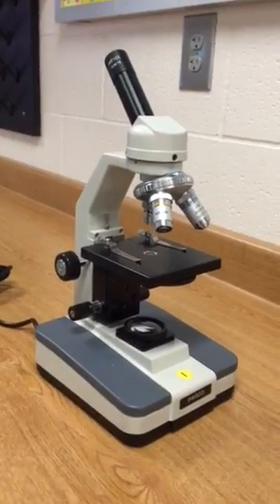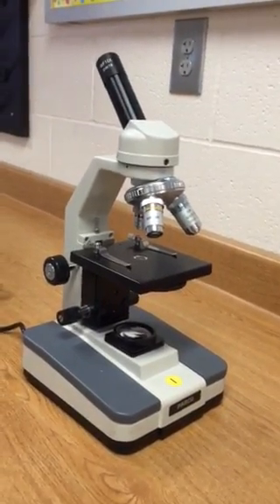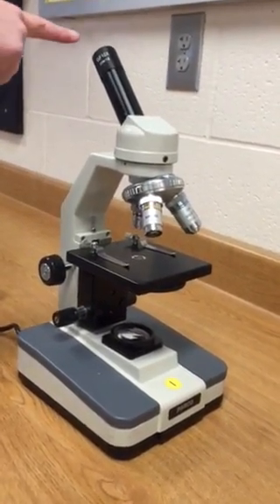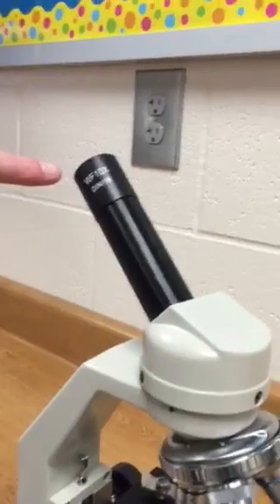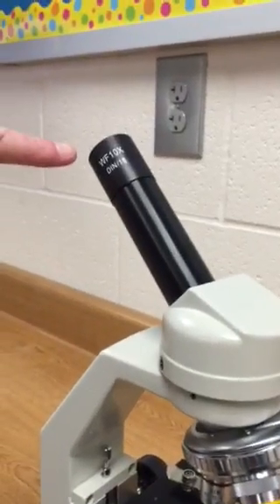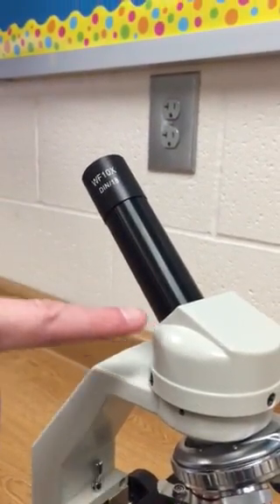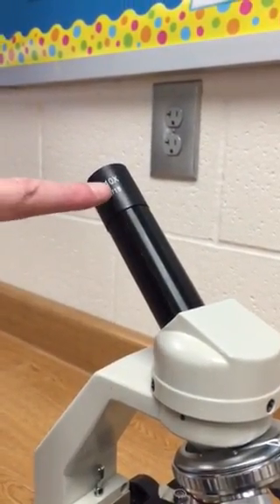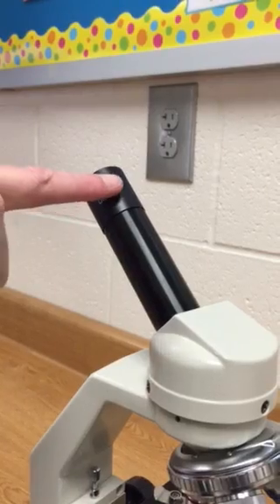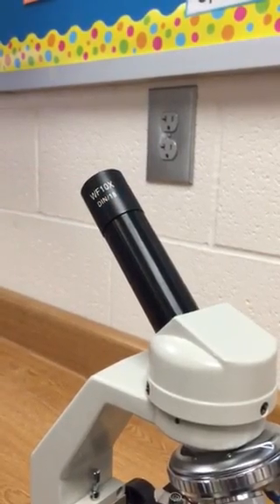Here are the parts and the functions of the microscope. Up top we have the eyepiece, which is where you look through into the microscope. You'll notice it has a 10 times magnification.